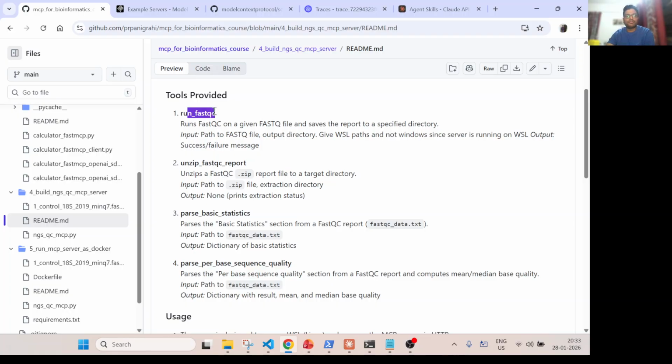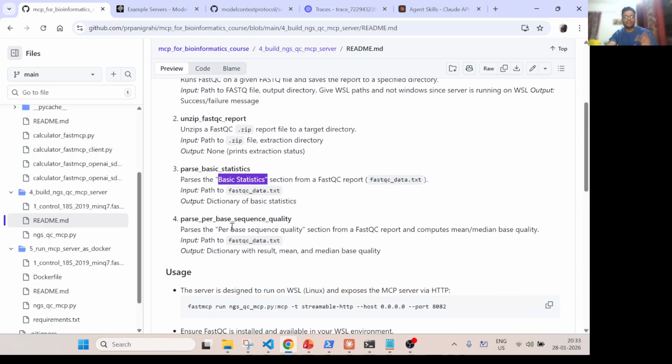Once we run FastQC, it will generate a zip file, and then you need to unzip it. For unzipping, I'm using a Python package. Once we unzip, it will give us the extracted files, including the fastqc_data.txt file, from which we are parsing basic statistics and also per base sequence quality. So basically these are simple Python functions, which allow us to do a lot of things in this MCP server.